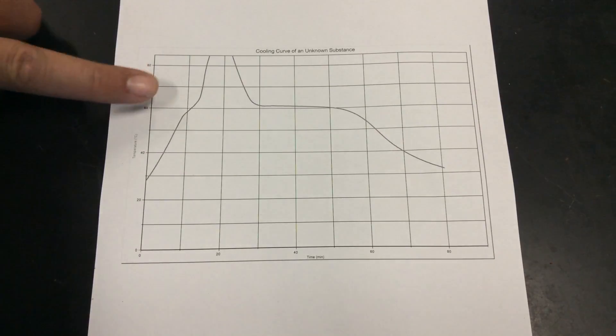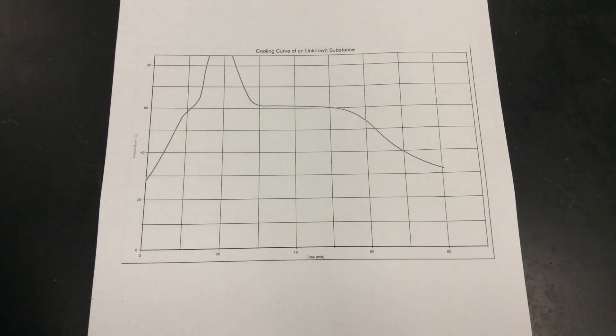Because it's difficult because the heat is being absorbed by the solid and the thermometer in all different places. It's better to watch it cool. It's hard when we're giving the system a lot of heat and seeing where the temperature stays constant. That's really difficult to do. But we can observe it anyway.